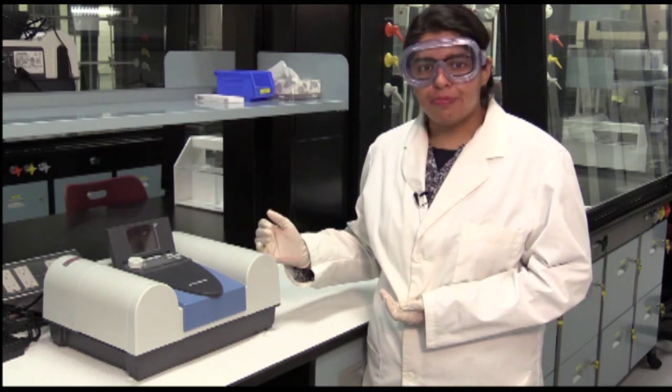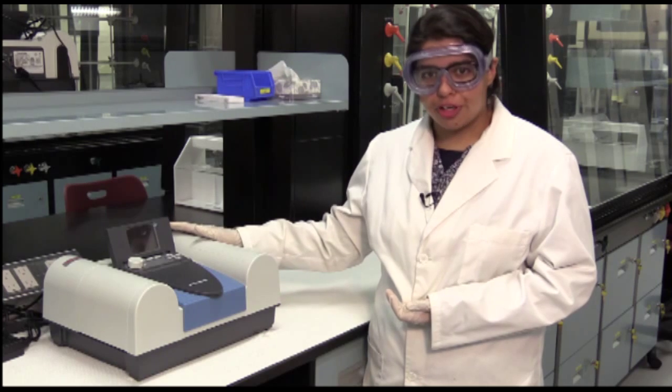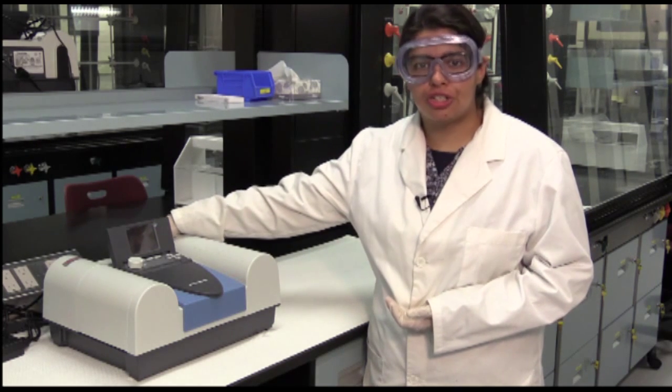So to begin operation, all you have to do is plug it in first, and then reach for the back and find the switch to turn it on.